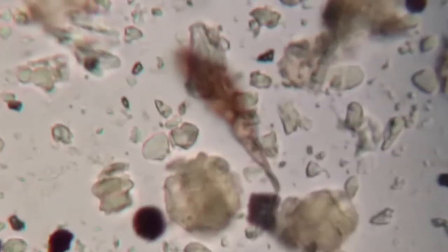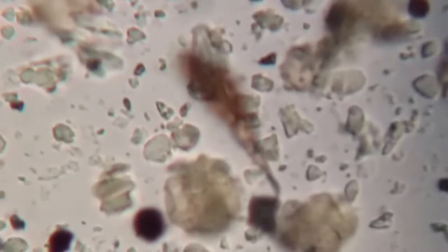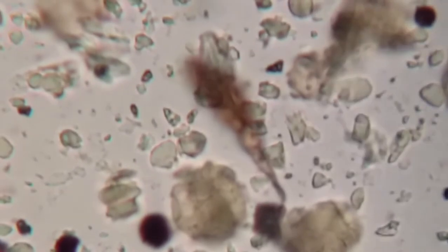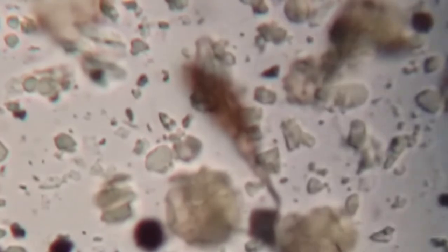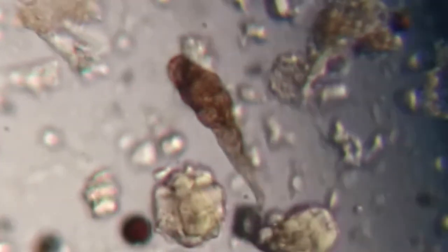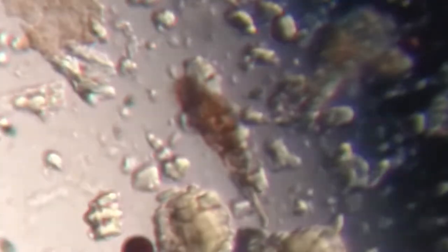For example, if you focus right now on this long dark brown segment towards the middle of the screen — this kind of doesn't look like much, but you can see a lot of very crisp small specks around there. Now watch as we focus for the large smudge: those other specks start going out of focus, but we start seeing a lot of clarity in what appears to be a germinating fungal spore.